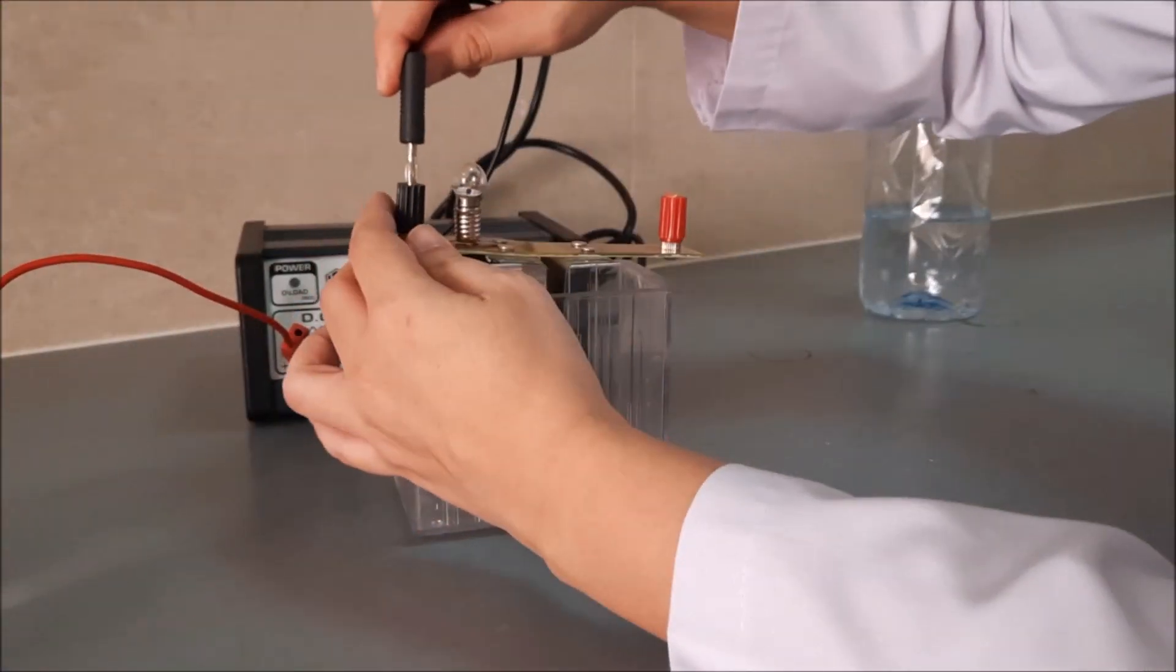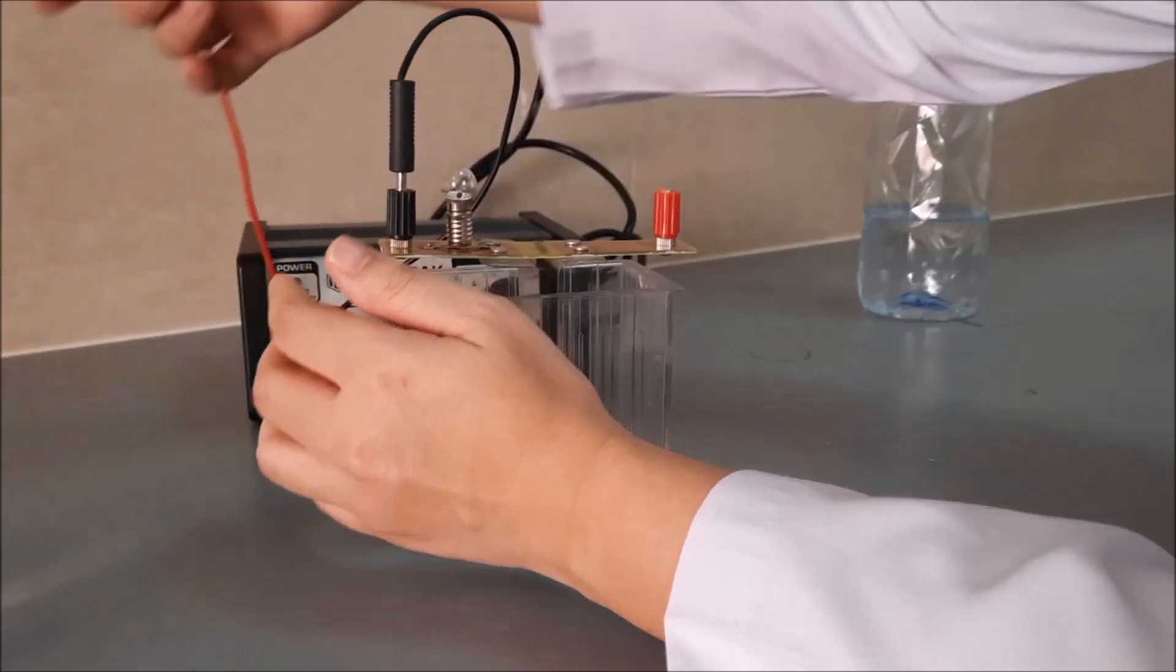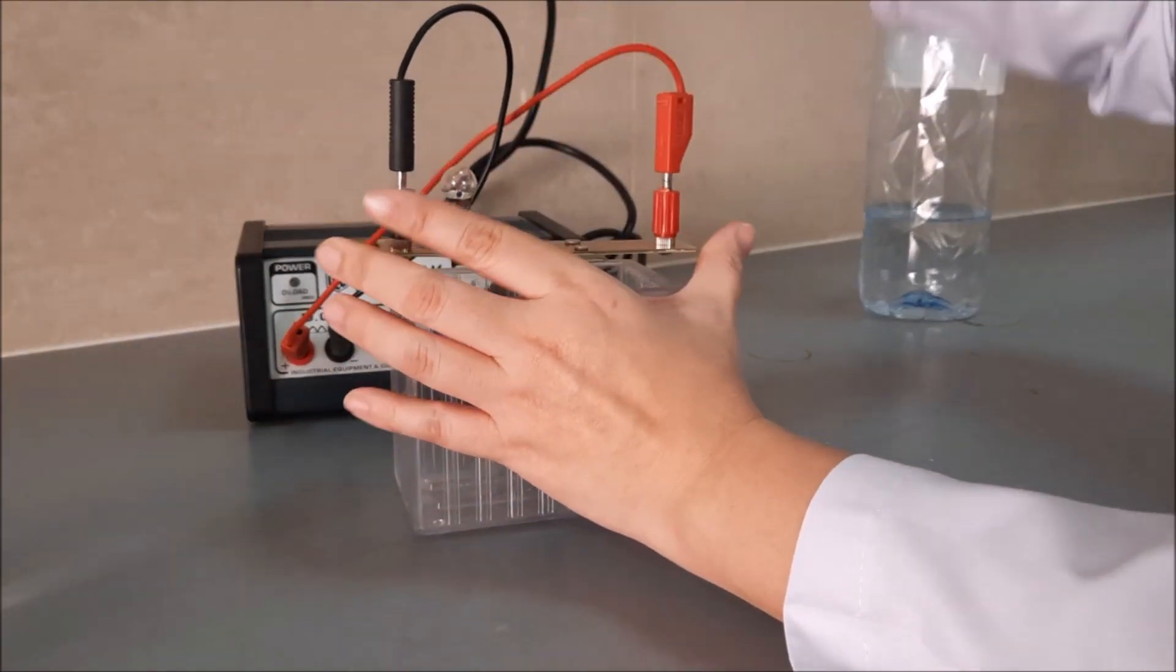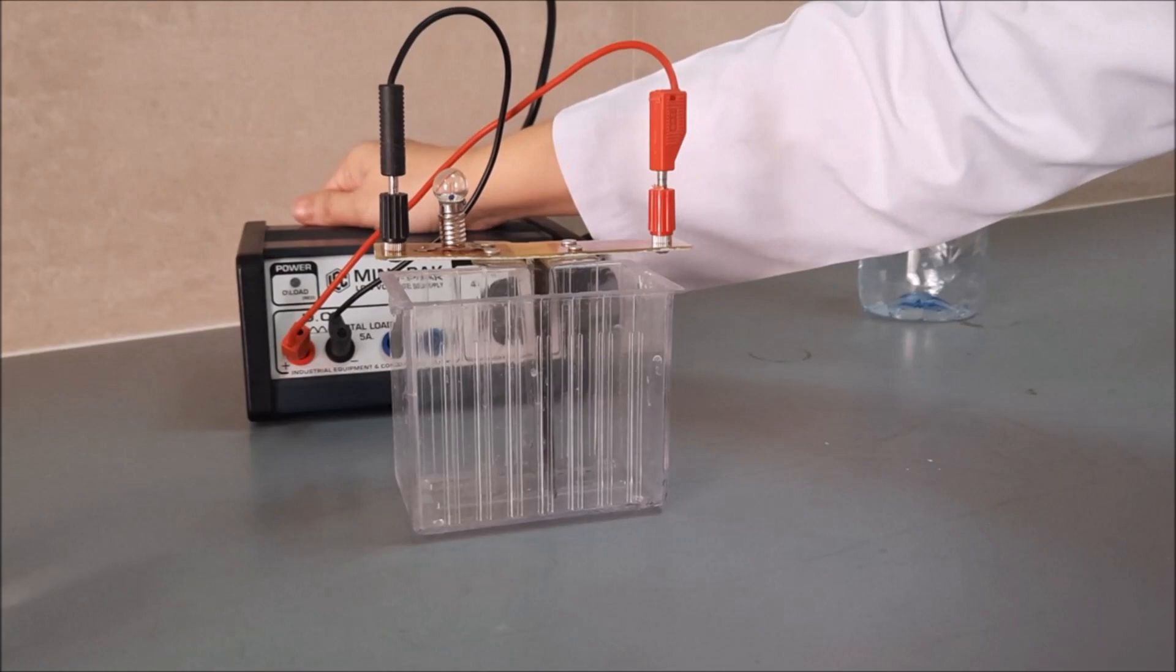See this? I will put in the negative side, and in the positive side. Then, I'll turn it on.